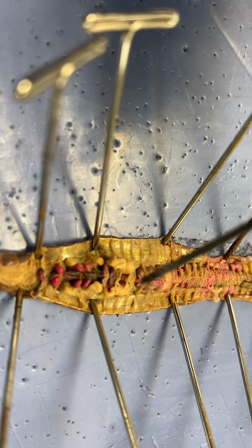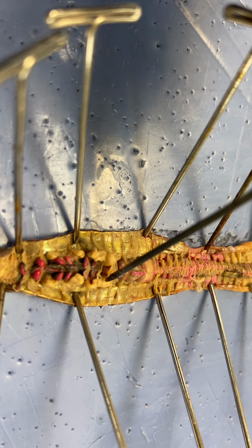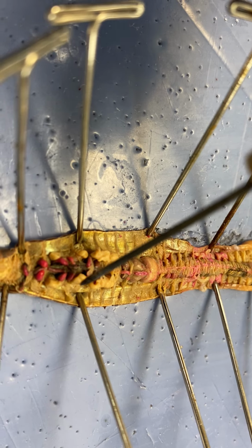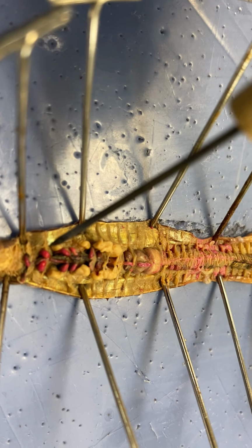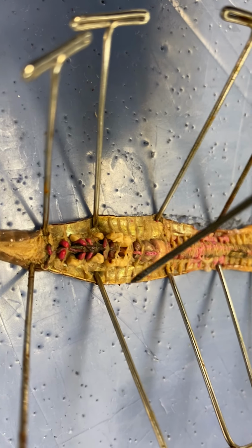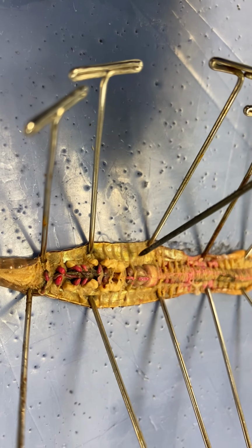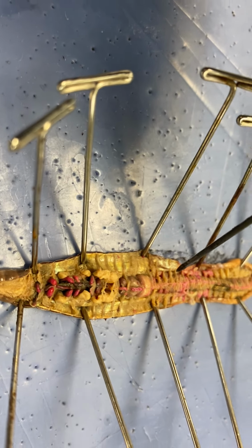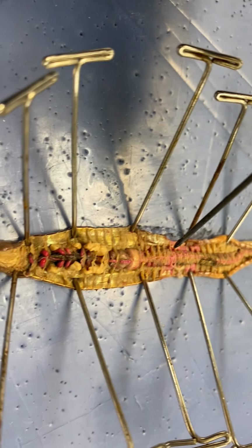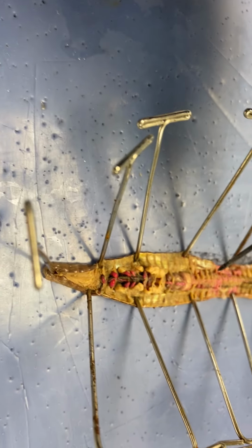Then you have the larger ones right here, closer to the crop, which are the seminal vesicles. And the two little circle ones on each side are the seminal receptacles. You have septa, which create the internal segments and put the body in little compartments. And that is pretty much all it is for the earthworm.